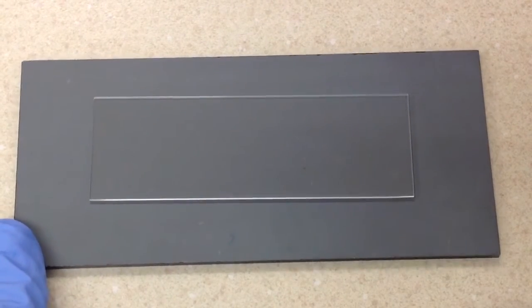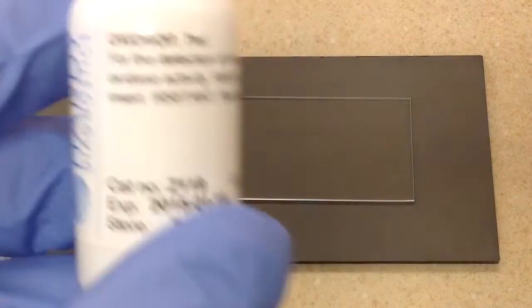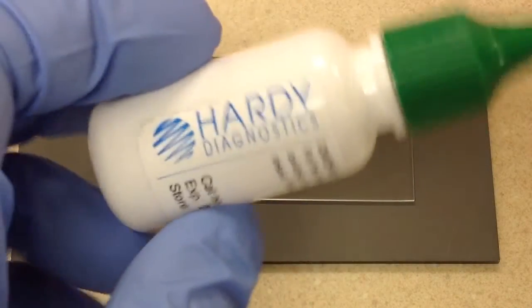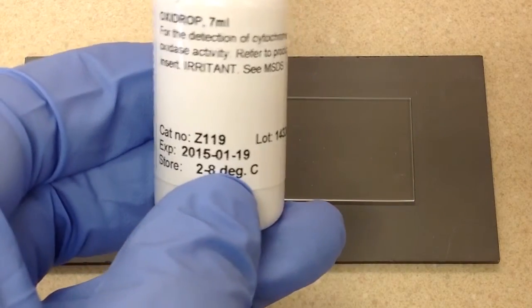In this video, we're going to be doing the oxidase test, and we're going to be using the Oxydrop reagent by Hardy Diagnostics.